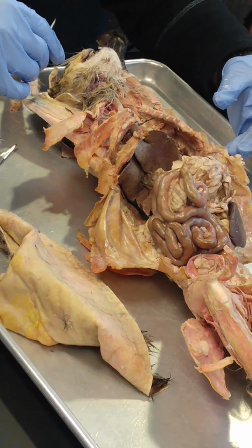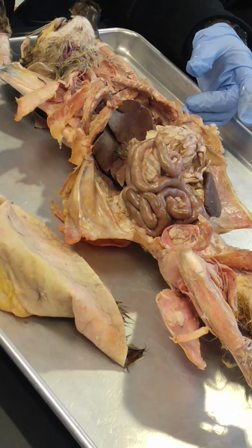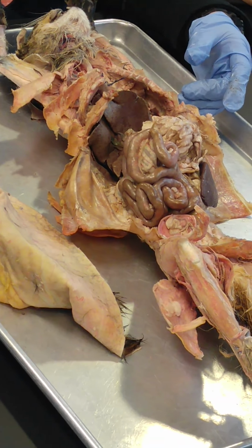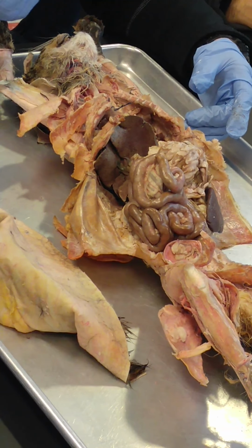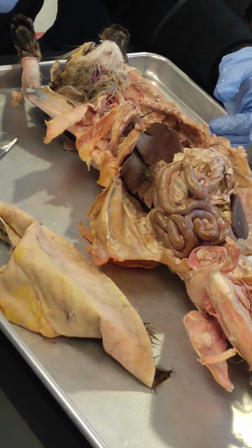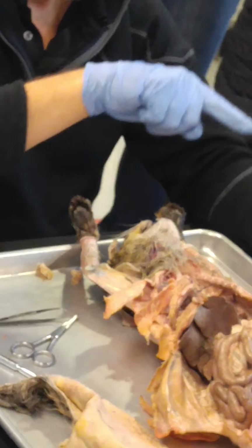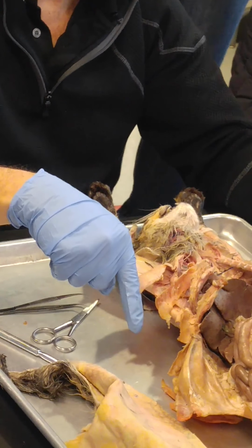So the next thing you've got is the colon. Now, if we look at the colon in a human, we start out first with the cecum, then the ascending colon, then it goes across to the transverse colon, then the descending colon, and then it has kind of an S shape, which is the sigmoid colon, down into the rectum and anus. So it goes up like this, goes across, goes down, a little bit of an S curve, and then rectum and anus. That's a human.